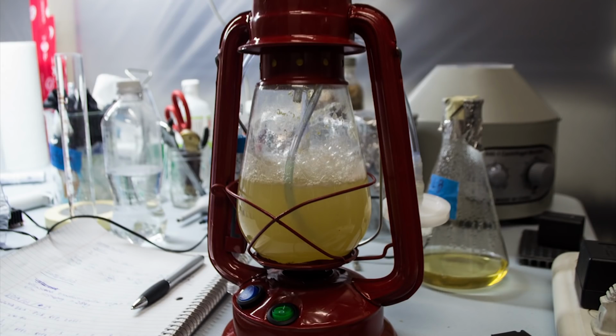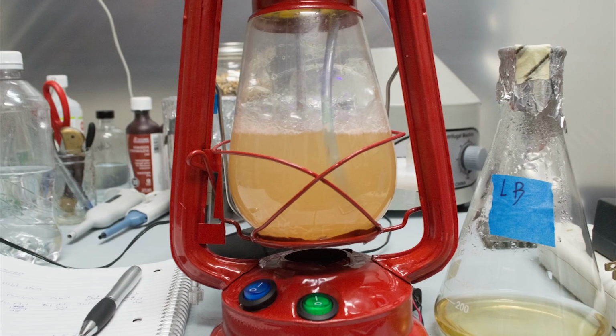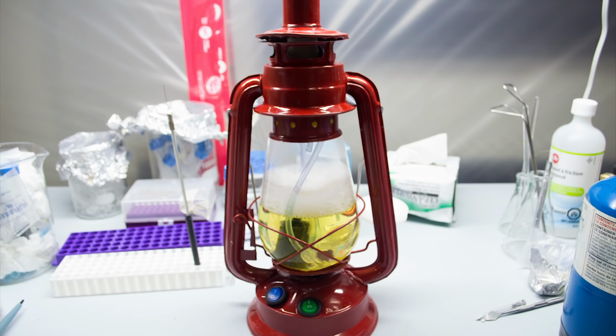I think this project was a big success, and I'm super excited to use this for all sorts of upcoming projects anytime I need a lot of an organism, or want to have a reaction that just runs continuously. When we eventually get the spider silk project working, I'll definitely be using this to churn out buckets of silk protein to play with.